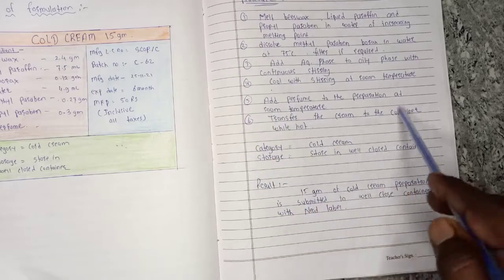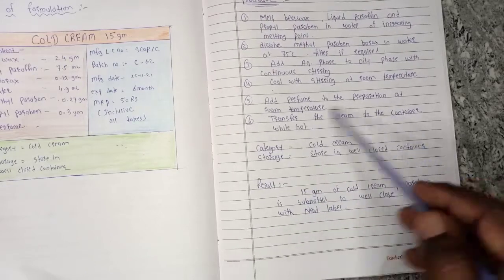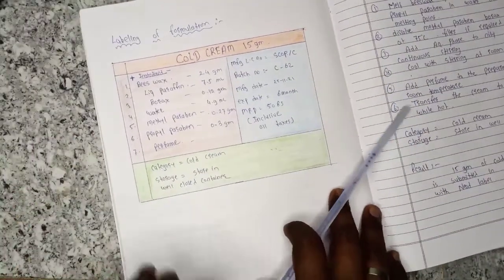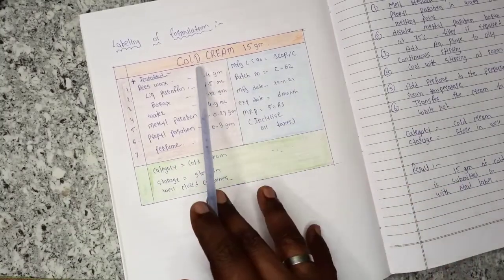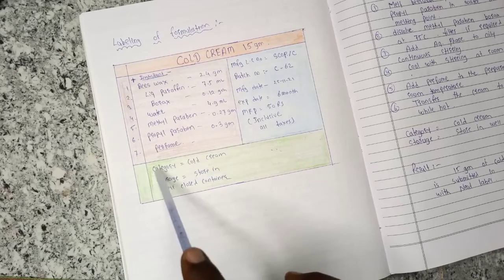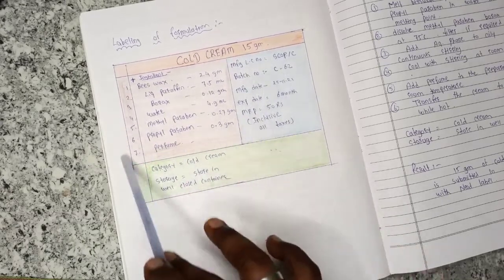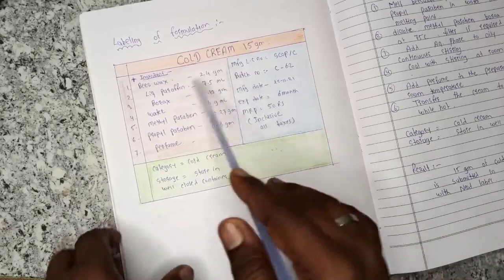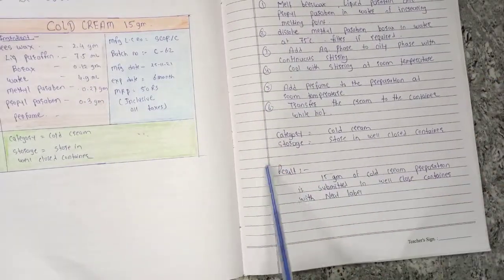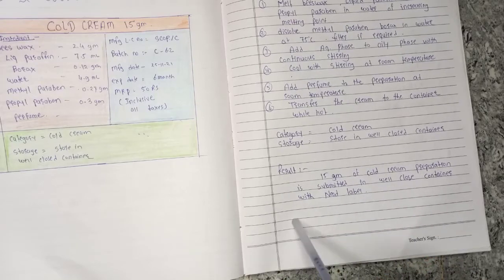Transfer the cream to a container while hot, then allow it to cool to room temperature. Add a label to the cold cream container which includes: ingredients, storage condition, category, batch number, manufacturing date, expiry date, and MRP. The result is 15 grams of cold cream preparation submitted in a well-closed container with a neat label.